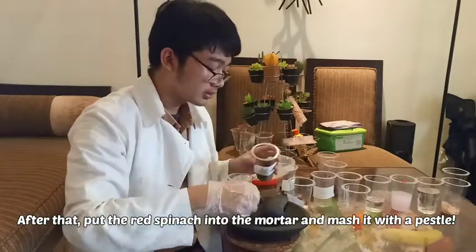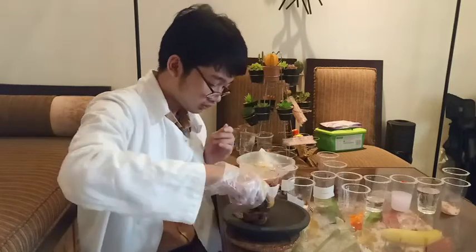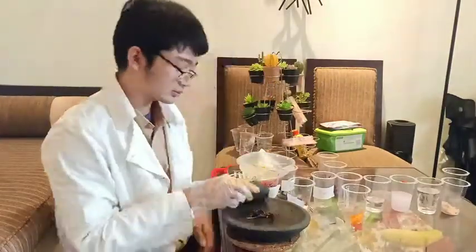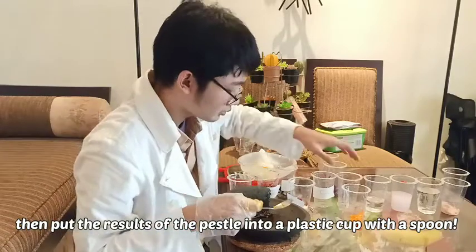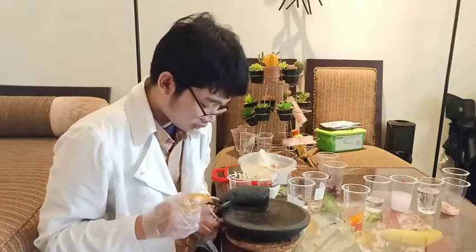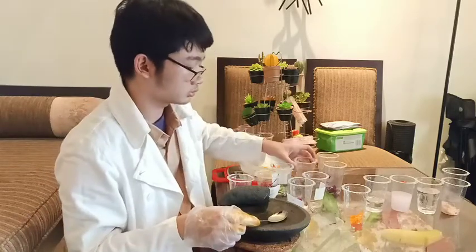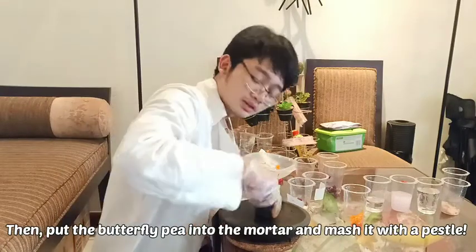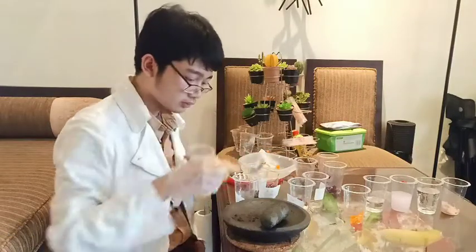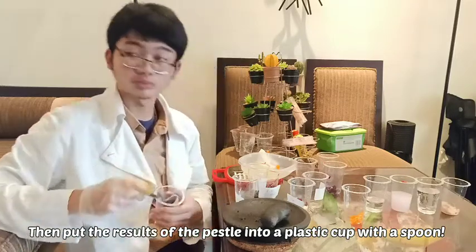After that, put the red spinach into the mortar and mash it with a pestle. Then put the result of the pestle into a plastic cup with a spoon. Then put the butterfly pea into the mortar and mash it with a pestle. Then put the result of the pestle into a plastic cup with a spoon.